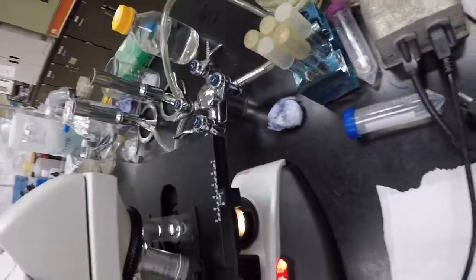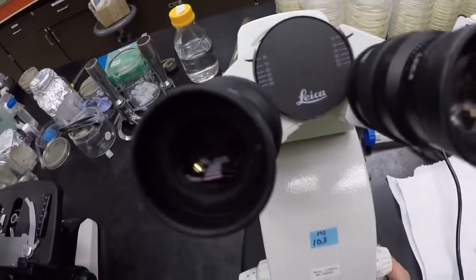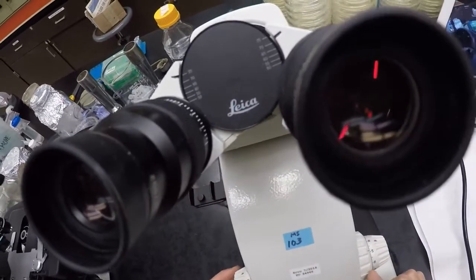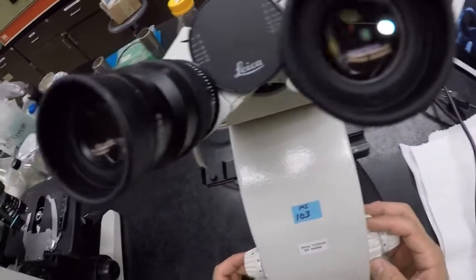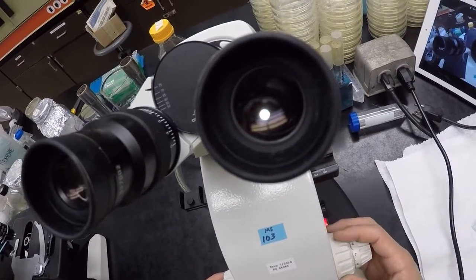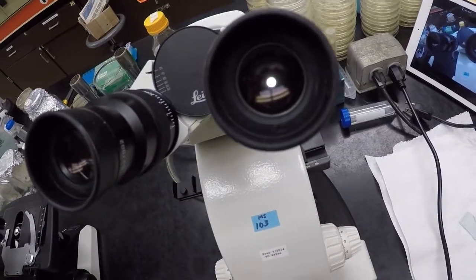Right? Focusing works pretty straightforward. Never focus unless you're looking. Alright, so look into the eyepiece, and then while you're looking, if you guys look at my hand down there, while you guys are looking, gently turn until you get it into focus. And right about over there is in focus.